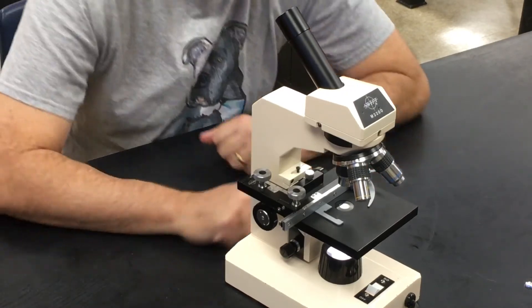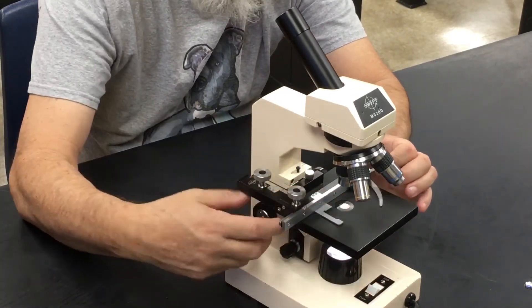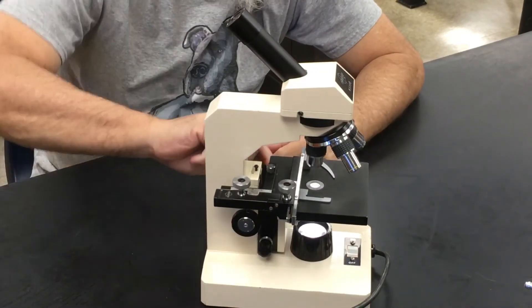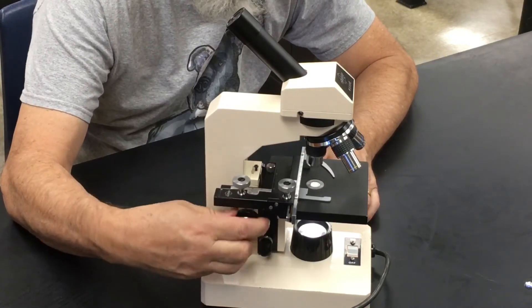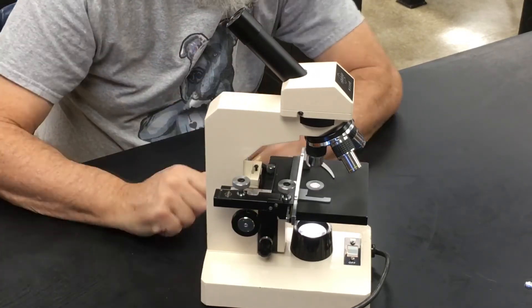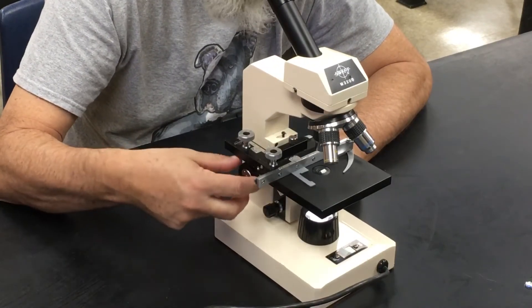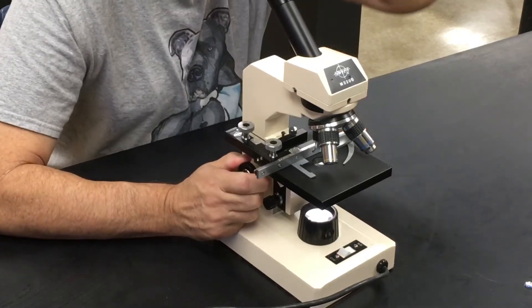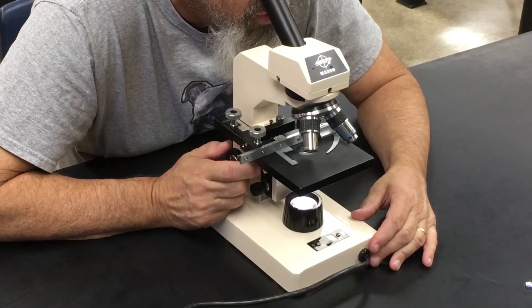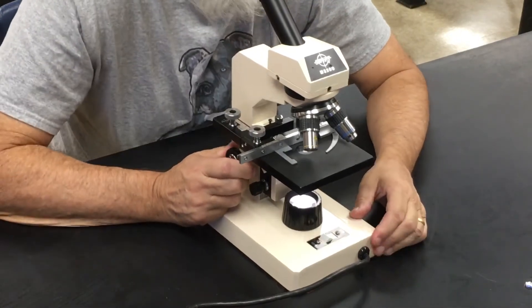Now I'll go through how to focus the microscope. You take your specimen, put it on the slide, and first make sure you're on the low power objective. Lower the stage as far as it will go with the coarse focus knob — turn it away from you until it clunks. Then carefully place your specimen on the stage. To focus, take the coarse focus knob and turn it towards you until it clunks, then look through the ocular lens to see if you can find your object.